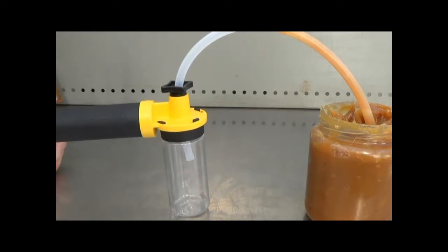There will be no overfilling although the bottle may end up being quite full if you leave it long enough.